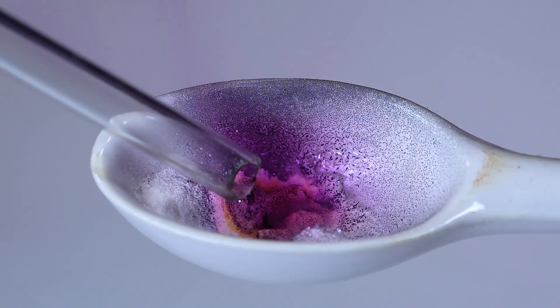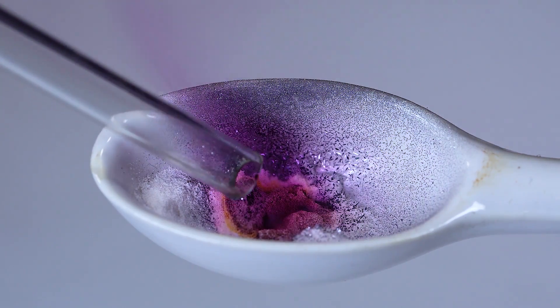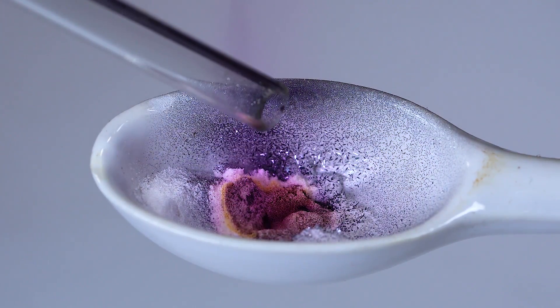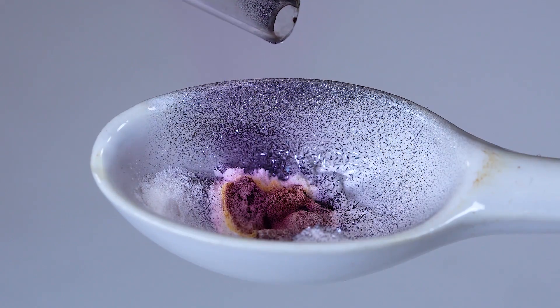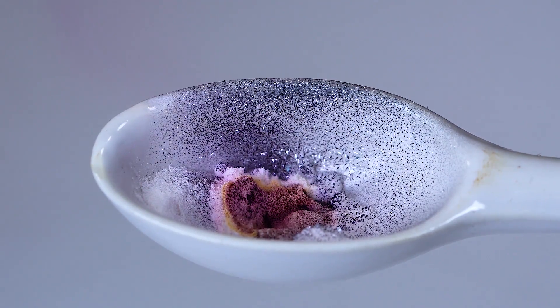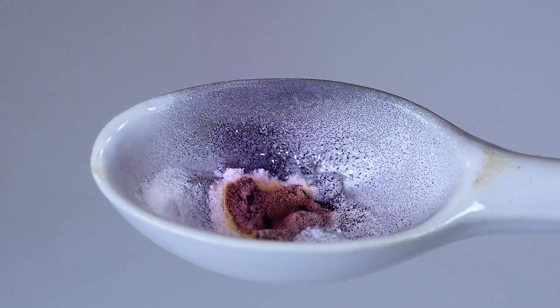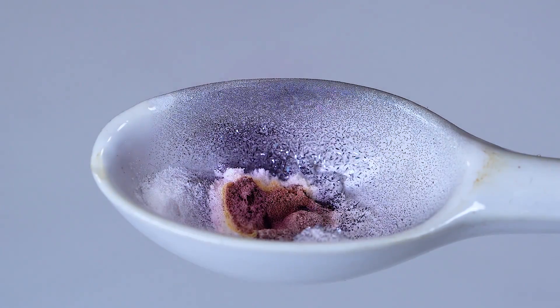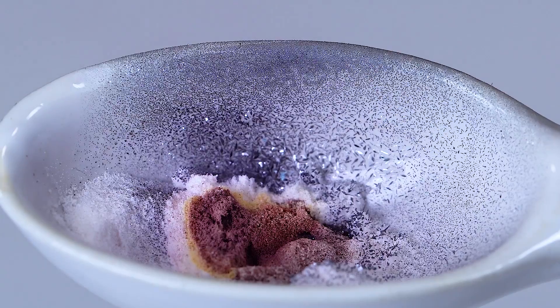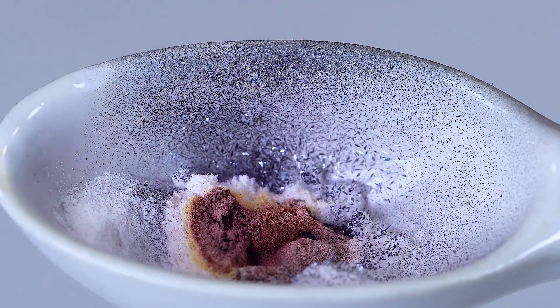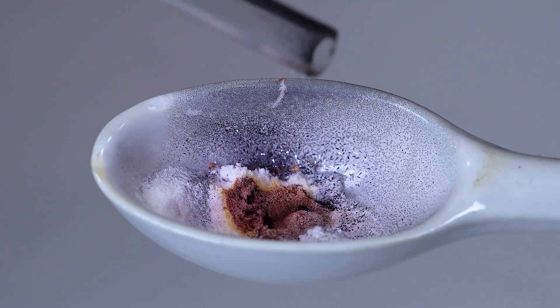If we stop carbon monoxide supply now, elemental iodine will stop forming as well. See? Iodine is not forming anymore, but if we restart the carbon monoxide supply, we'll see iodine forming again.